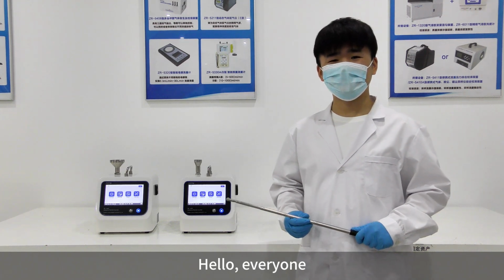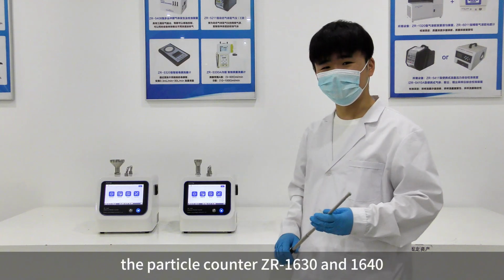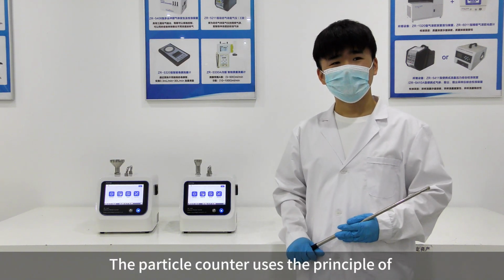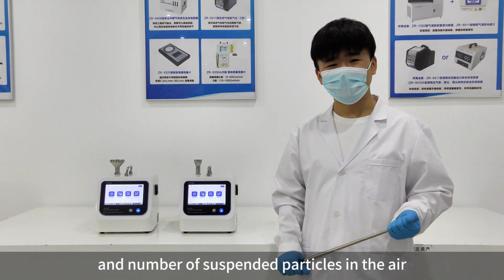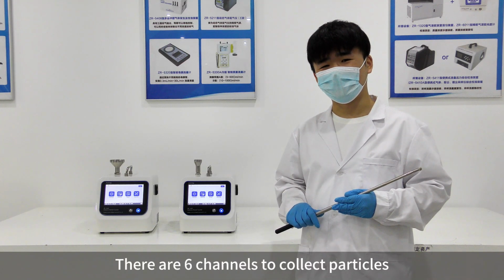Hello, everyone. Today we would like to introduce the particle counter ZR1630 and 1640. The particle counter uses the principle of light scattering to measure the size and number of suspended particles in the air.